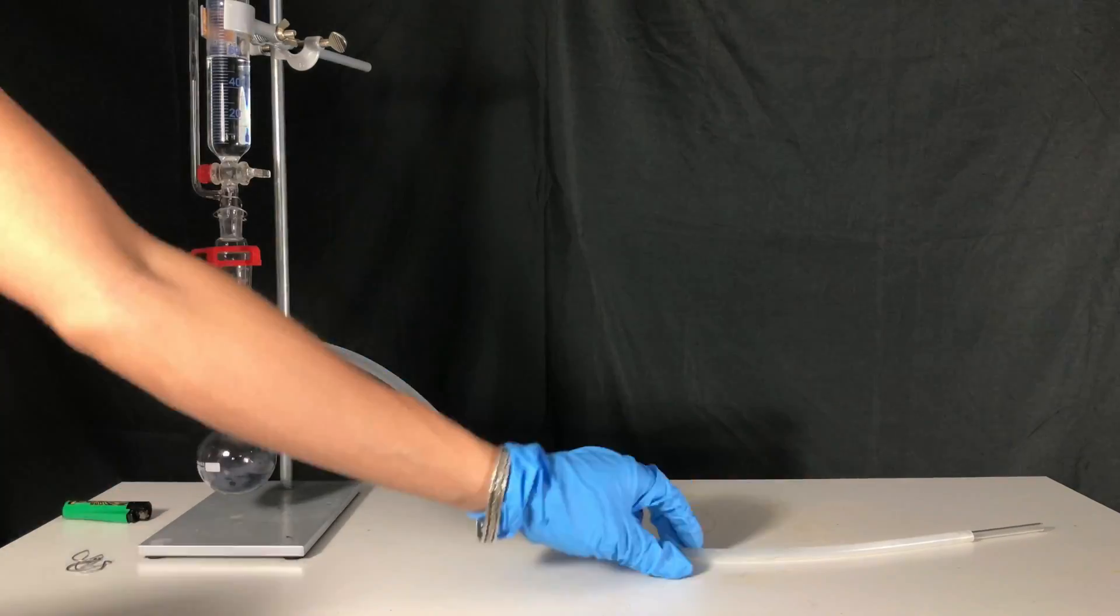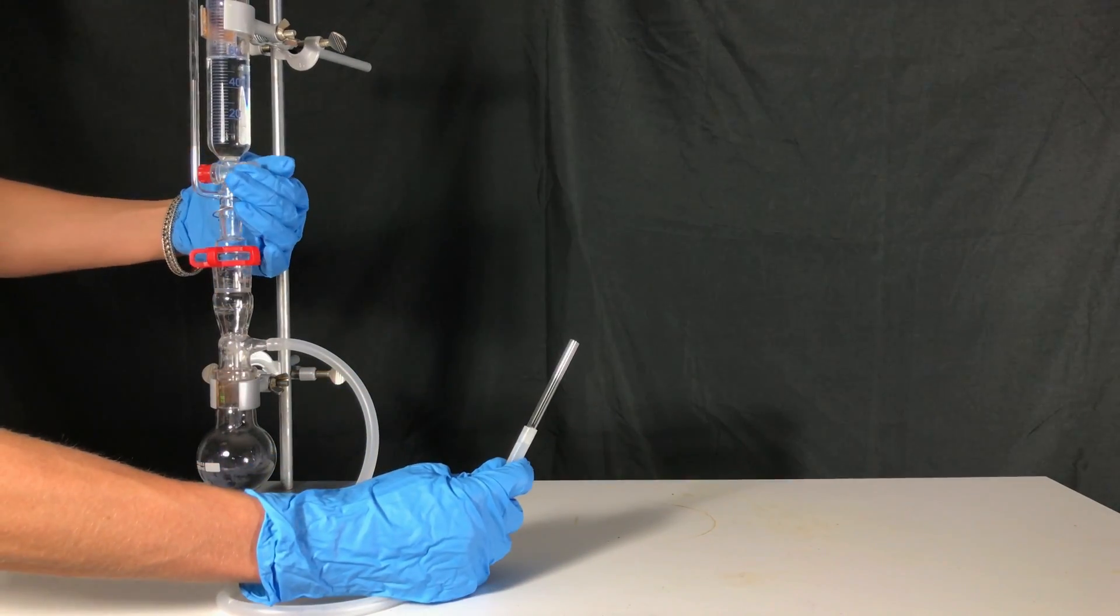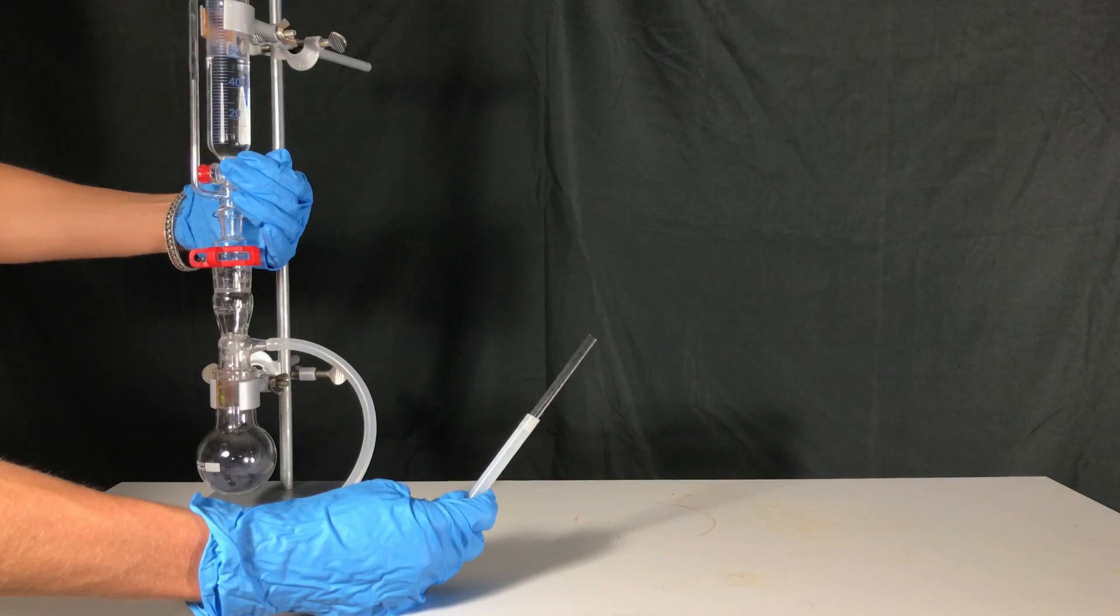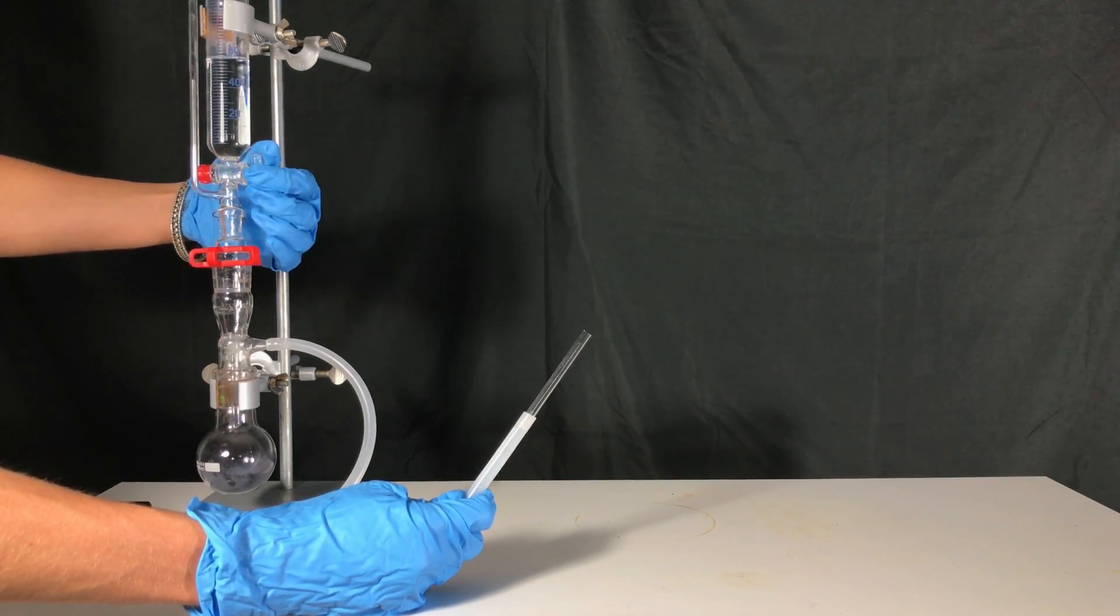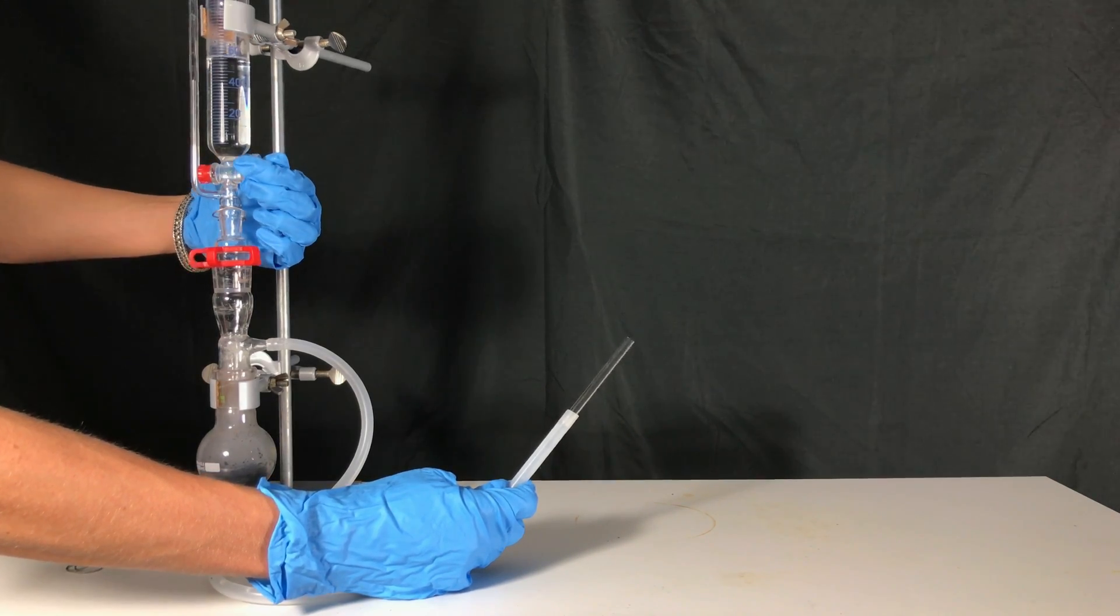Now for the fun part. Let's start hydrochloric acid addition. Upon contact with the magnesium silicide, you can see an immediate reaction.